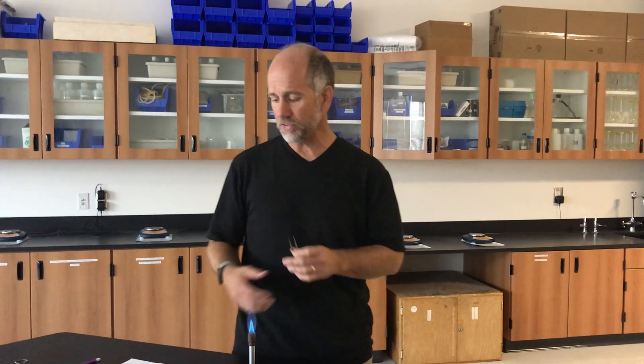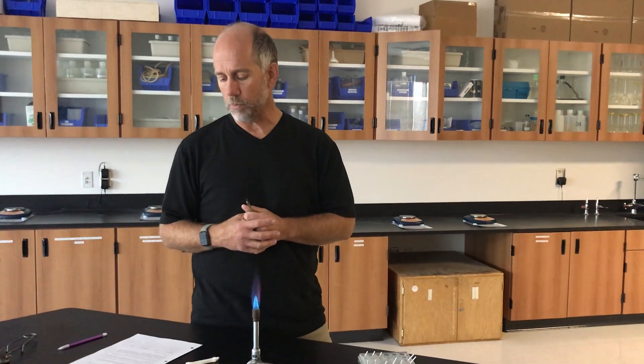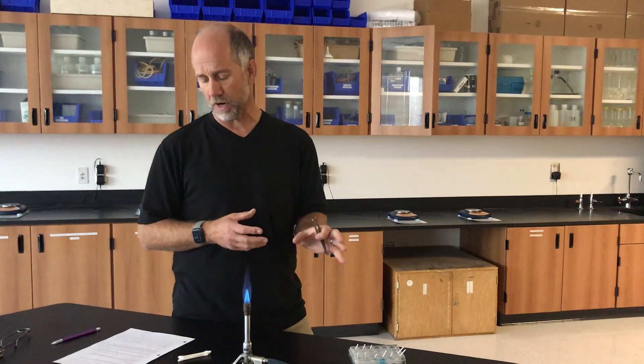The idea is that the light is representative of energy, which then gives us an idea of position, which then led us to the Bohr model of the atom. So doing these in order, as you see in step two in the lab, we already have our micro well tray all set up with all of our solutions.